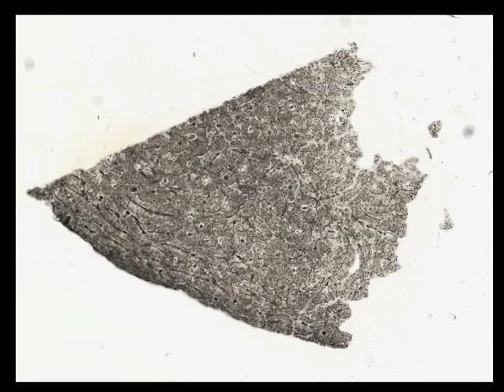If we move up a little bit in magnification, osteons cut in cross-section and so presenting a circular appearance are immediately apparent. And you can see that the osteons aren't perfectly regular in shape, but rather that they tend to be a bit variable. And you can also see regions, say for example here, where there may have been an osteon in the past and perhaps there's a little bit of remodeling that's either going on just now or has gone on.